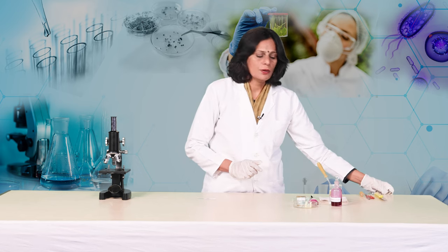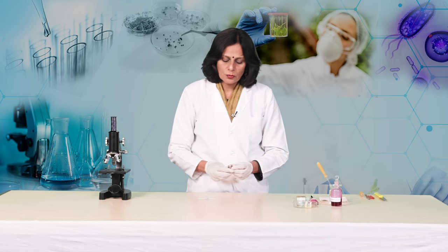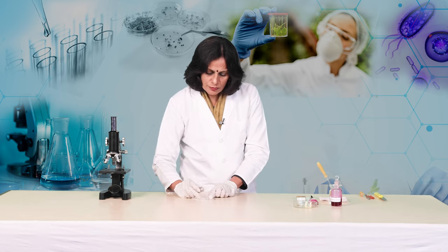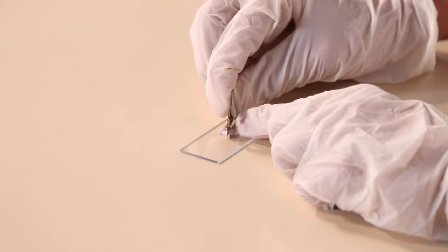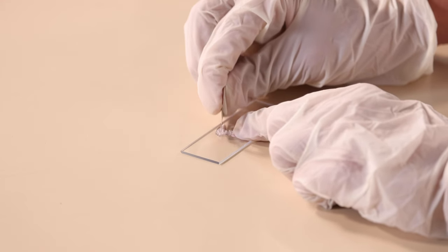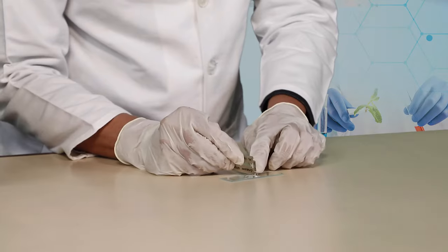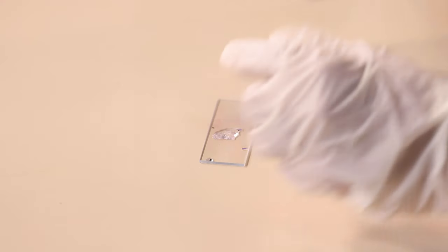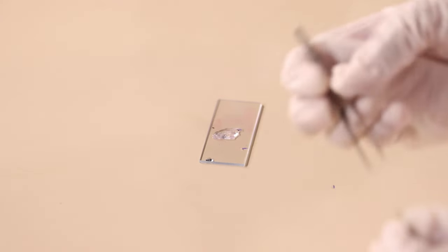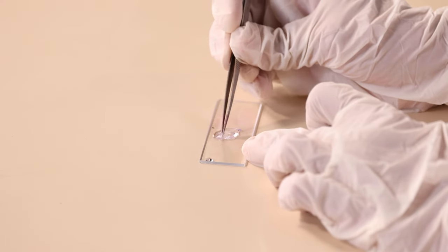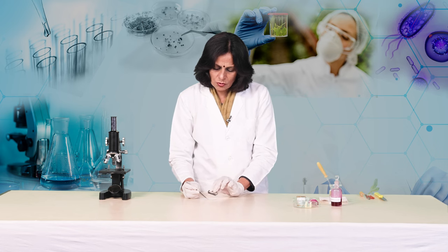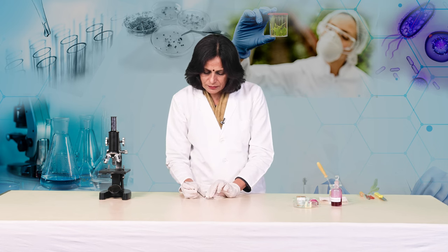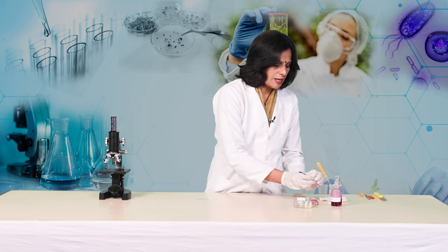With the help of the blade, we are going to cut it into a proper shape, which can be a square or a rectangle. We are going to remove the extra material. We have to discard this material once we have cut it into a proper shape.